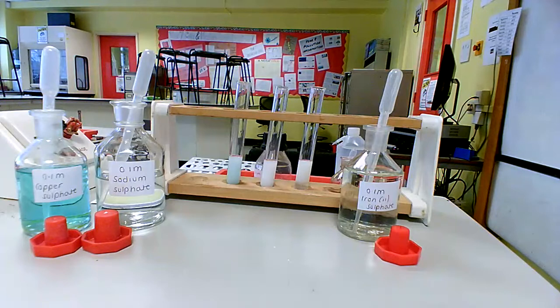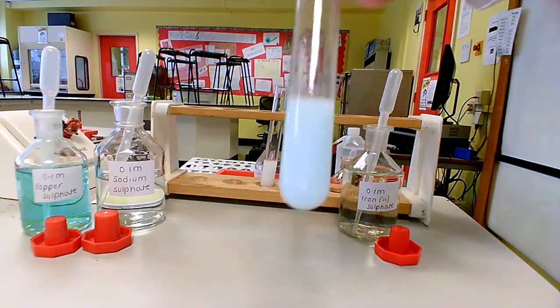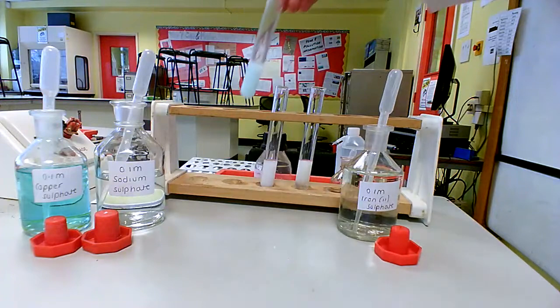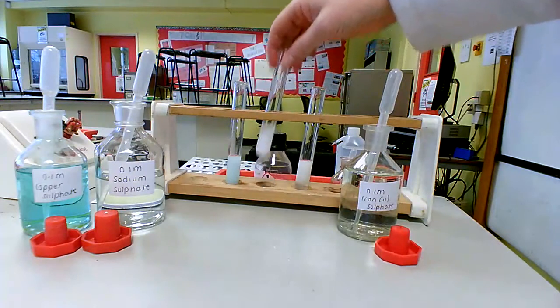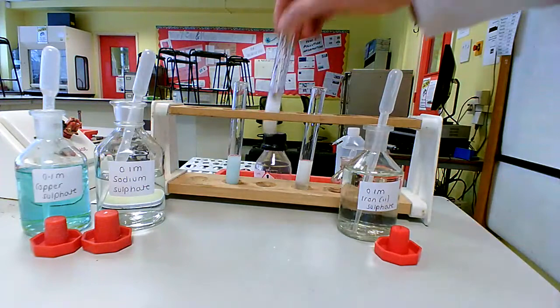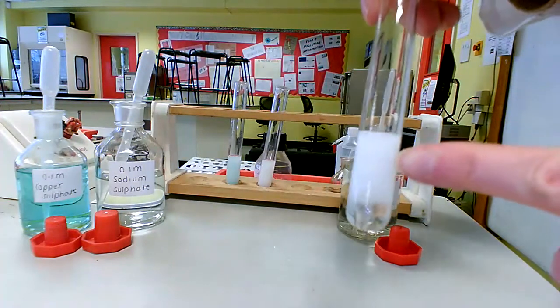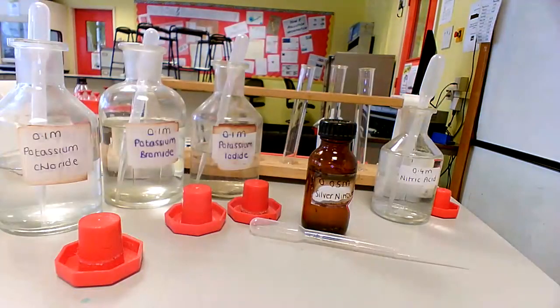So because we've added barium chloride, in each case we've got barium sulfate, which always forms the same colour precipitate, which is white. It's not very easy to see, there is still that blue tint, but if we'd left it for long enough we would see the precipitate settling at the bottom and it would be white. That's already white, we can see that at the bottom there, and this is also the white precipitate of barium sulfate. Now for the final tests for halide ions.